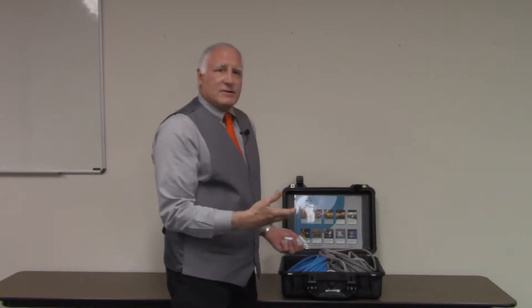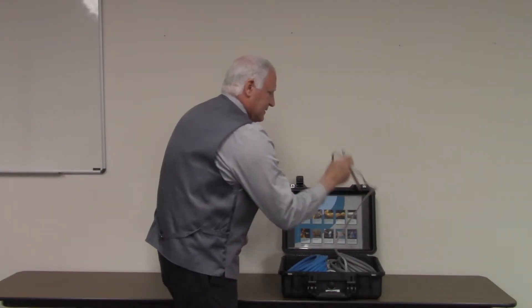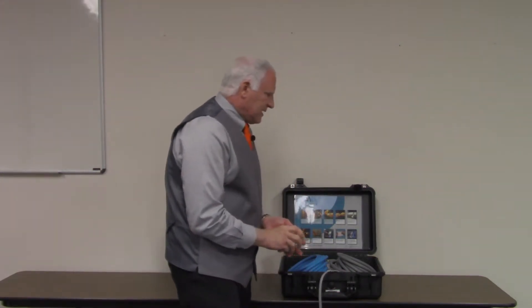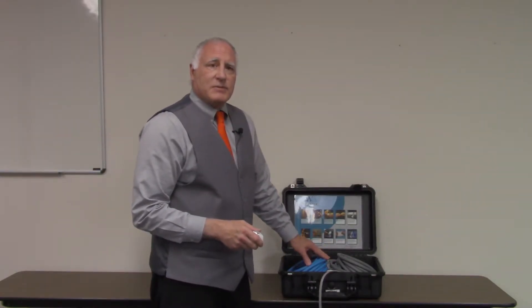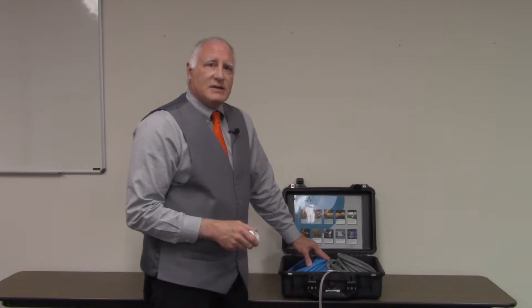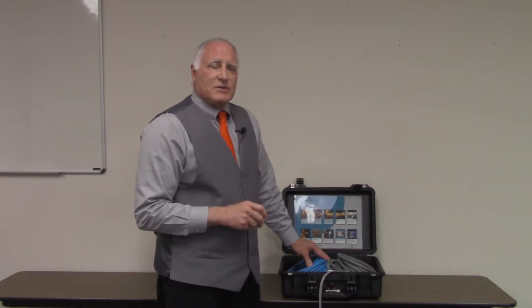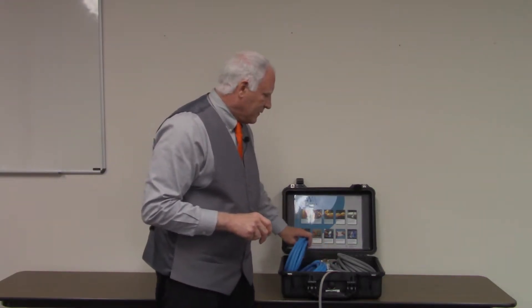The Wonder Air unit has two separate hoses. It is powered, so you're going to have to plug that in. The two separate hoses allow you to take samples in different areas at the same time — an outdoor sample and an inside sample, or a bedroom and a living room. These are 25-foot hoses, so you can stretch them out.